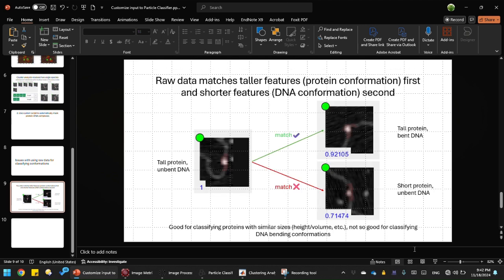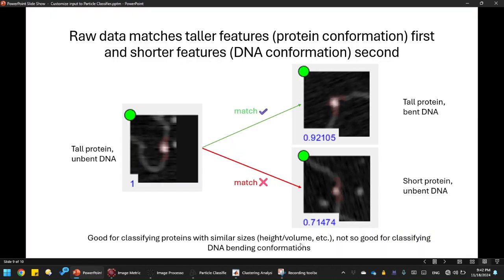Let me show you in this slide. So if you have 2, 3 of these particles, right? It matches first and foremost with the tall protein, but the DNA is basically secondary. Right? That's a match, even though DNA bending is different. This is an unbent state, this is a bent state. Because the proteins are both tall, it says it's a match. But for these two particles, you see the DNA bend is pretty similar, but because the protein is different, right? This is a tall protein, this is a short protein. Even though the DNA bend stays the same, the program says it's not a match. That's the issue when we use the raw data as our input for the particle classifier. So that's not good for analyzing the DNA bending conformations.